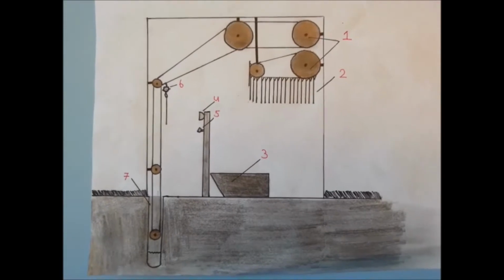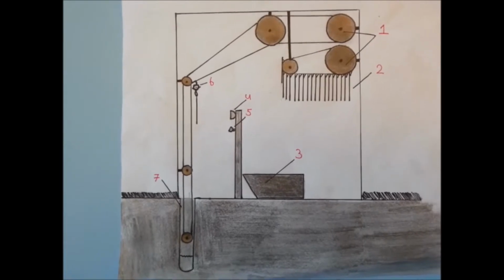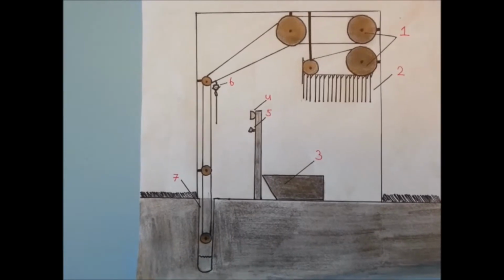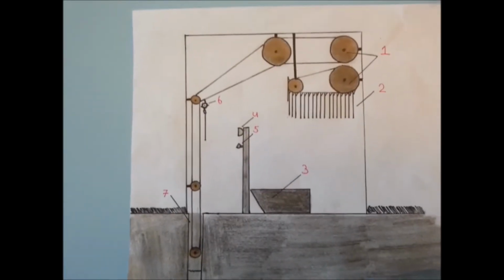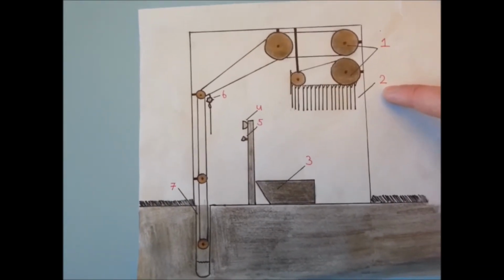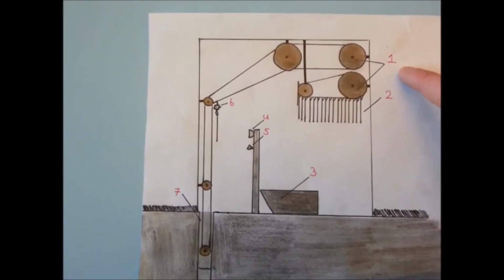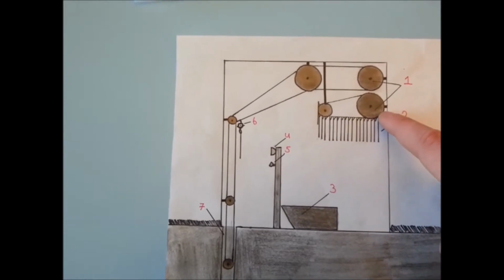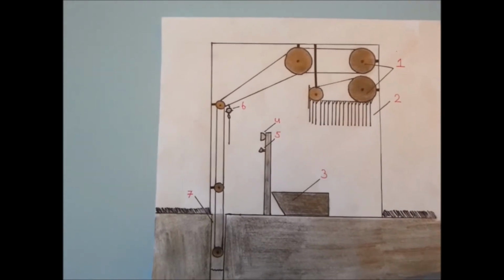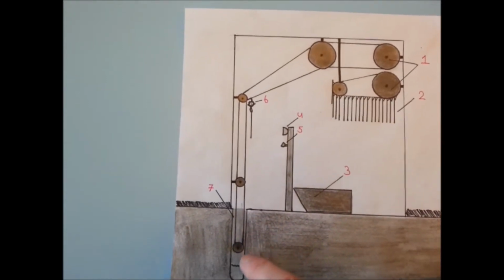What you can see here is the picture of a rough sketch I've made on what I think could possibly be my system integrated into a fully automated soil analyzer. At number 2 you will have the strips, which indicate different concentration. At number 1 there will be 2 light electromotors, which will power the transportation of the strips. First this one will go on, then the strip will go up, then the clamp, which is indicated by number 6, will grab the strip, then it will move from here into the soil here.